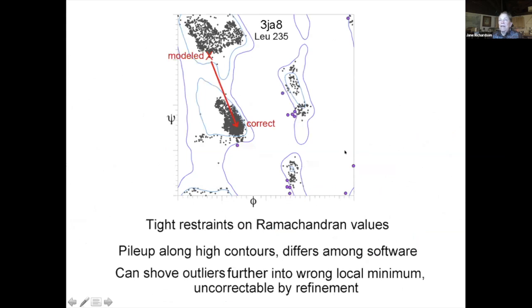So what's going on? In fact, presumably, originally this structure had lots of outliers. And when you have an outlier sort of in the middle of space, you don't really know which place in the Ramachandran plot it belongs. And it's even worse than that, because if you get a peptide turned around backwards, you will always be in the wrong part of the Ramachandran plot, because you're moving one of the Ramachandran angles by about 180 degrees, and that's going to take you to the wrong minimum. And so presumably this point was somewhere in between, maybe out here or whatever, and it got pulled in by Ramachandran restraints into the edge of beta and even way inside beta, and it really should be alpha helical.